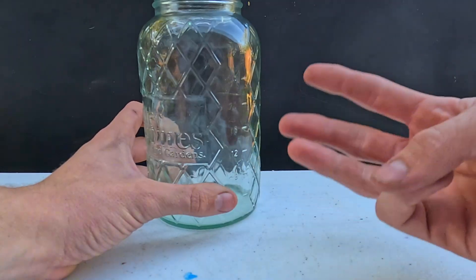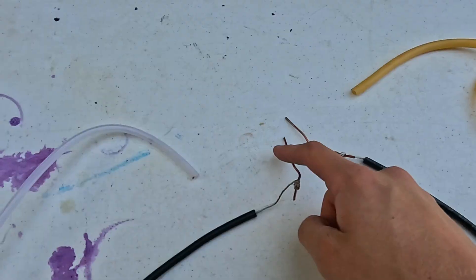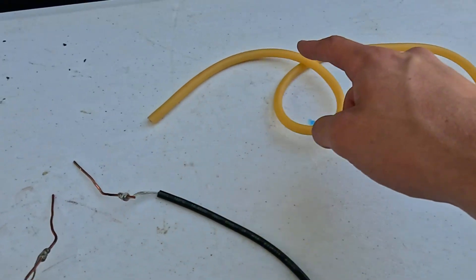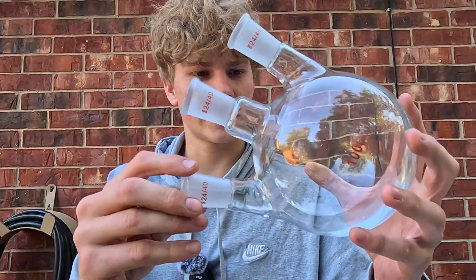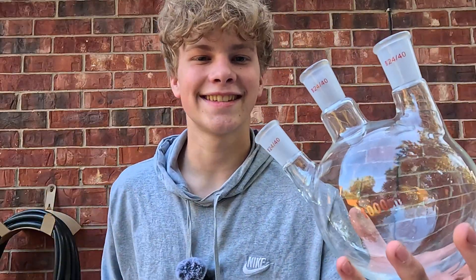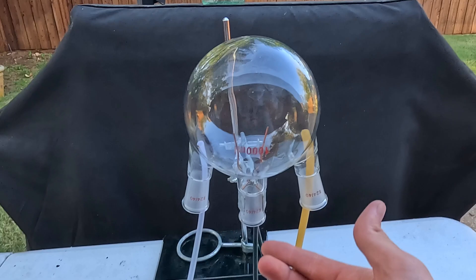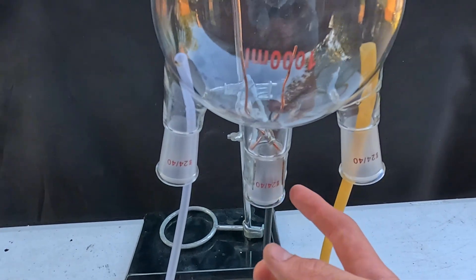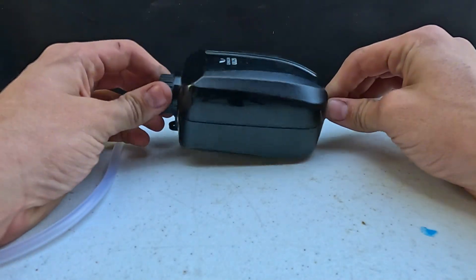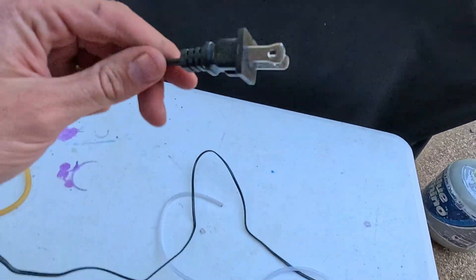We need some sort of container capable of doing three things: it needs an access port to produce the arc, then through some sort of tubing we'll pump air into the arc, and then once the air is plasmified, we'll need somewhere for that air to travel into a cup full of water. You can use a mason jar by simply poking three holes in the metal lid. We have air coming in through one pipe, the air gets plasmified in the middle, and the air exits into the jar full of water. The answer to pumping the air was solved by picking up an aquarium fish pump, because it slowly pumps the air, unlike other things that might do it too fast.